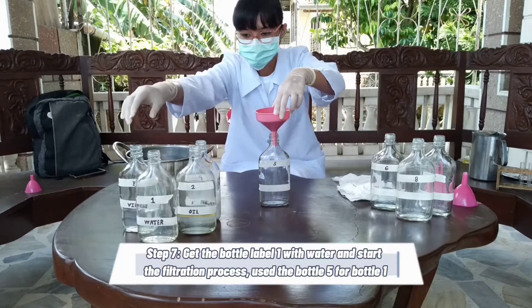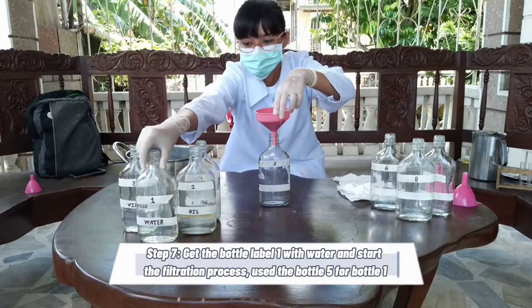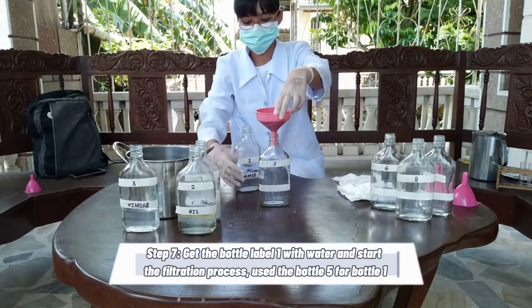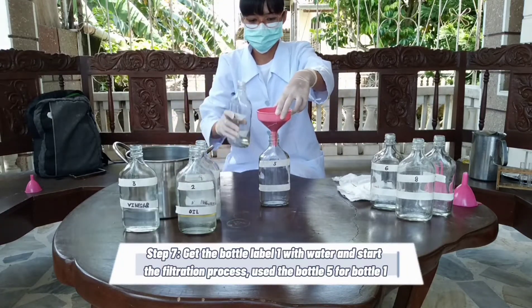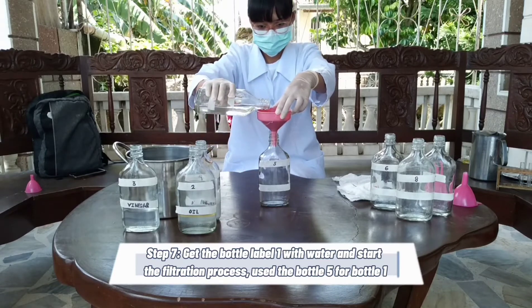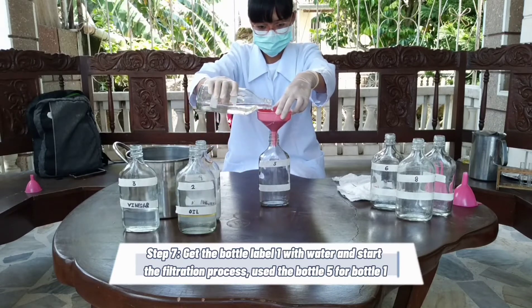Step seven: get bottle labeled one with water and start the filtration process. Use bottle five for bottle one.